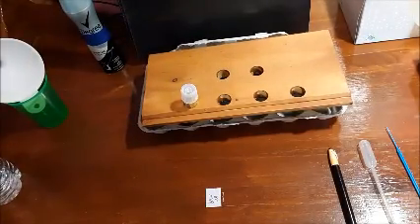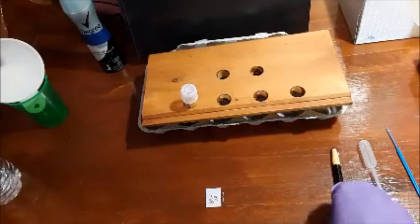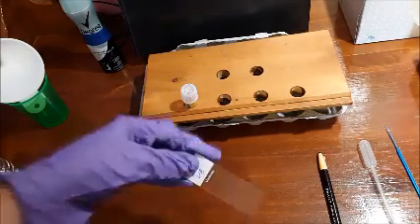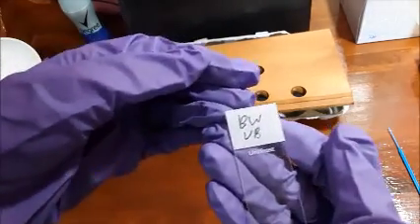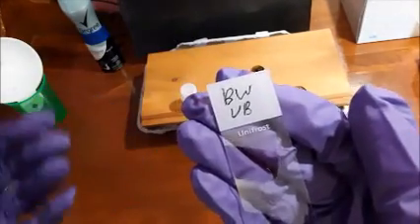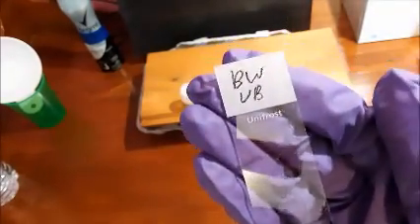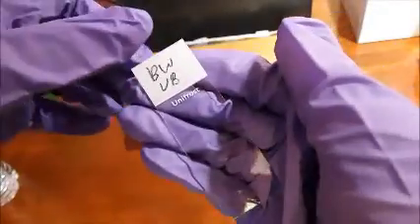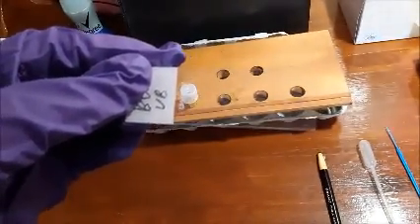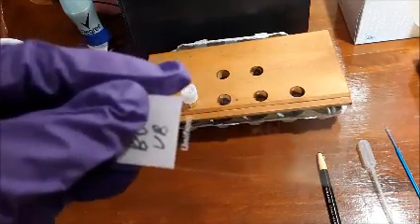So the first step in this experiment would be to label your slide, and you would do that with your China marker. I already did that step. As you can see, I already put my initials on there, and generally you would actually put the microorganism's name on the slide as well, but we actually don't know what our bacterium is, so I just put UB, which stands for unknown bacteria. And also, with your China marker, you're going to be creating a circle in the middle of your slide, and what the circle represents is the spot where your bacteria is going to be smeared on.